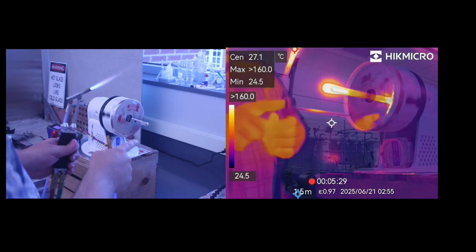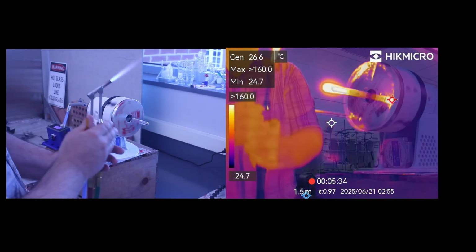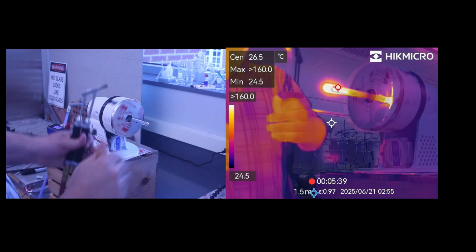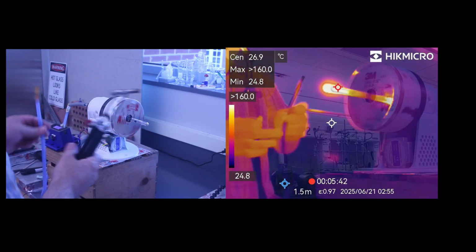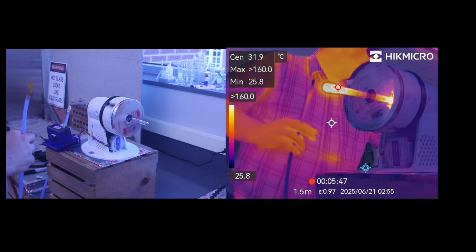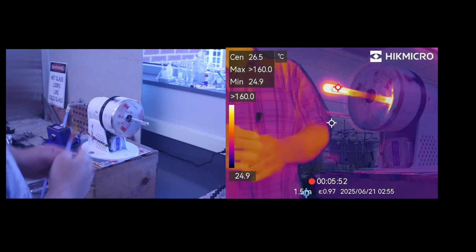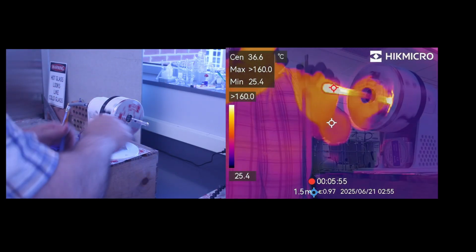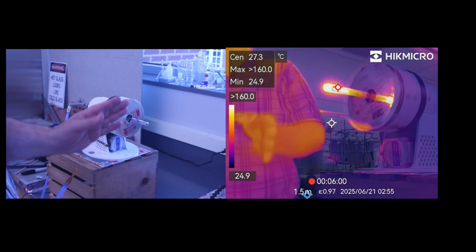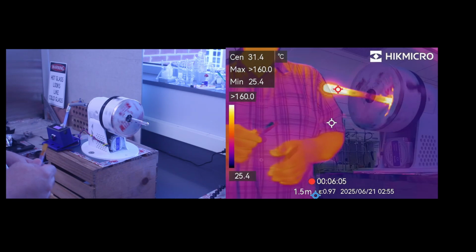At this stage, I'm happy with this. It looks like the end is a little bit on the thick side. I could adjust that by going back in, reheating it, and puffing it out, but for this demonstration, this is perfectly adequate. The only way you'll get comfortable using the blow hose is just to do things like this. Just make a little test tube, seal it, and make sure everything is as uniform as possible. And like I said, it just takes practice.